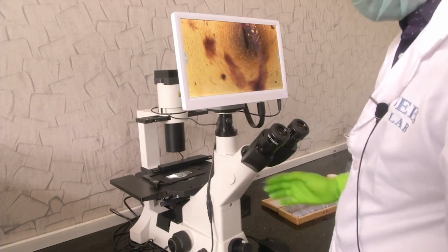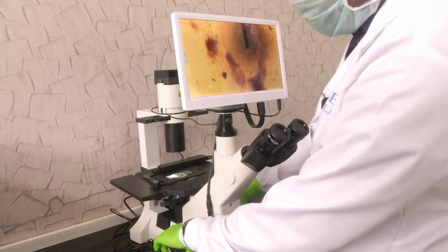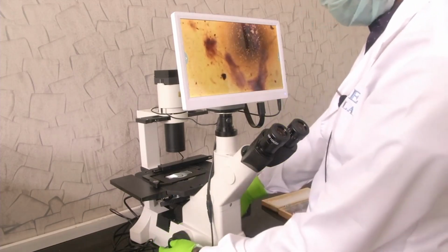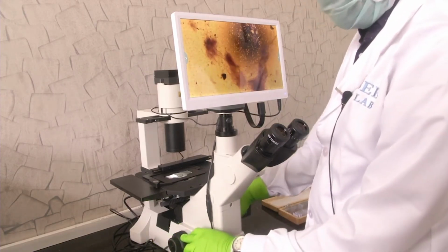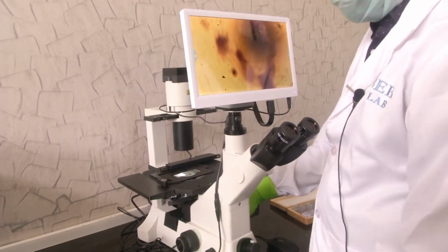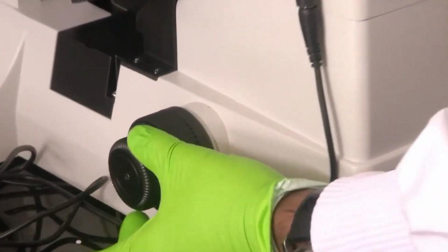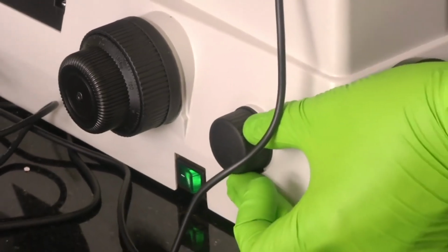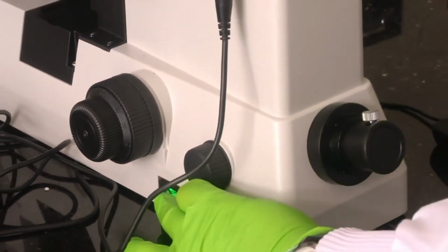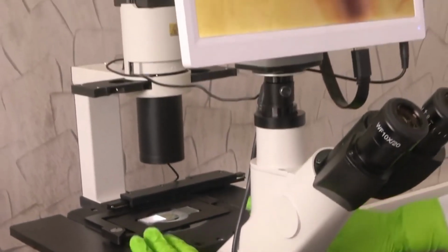Now, the other knobs in the microscope are common. As usual, there will be a focusing knob for coarse and fine adjustment. This bigger knob is for the coarse adjustment. This smaller knob is for the fine adjustment. We have the intensity adjustment through this knob, which will adjust the intensity of the light source, and a power on/off switch will be there.